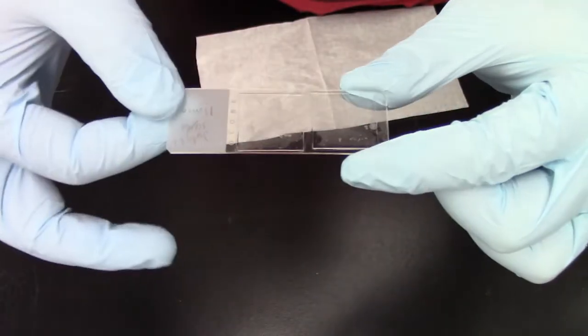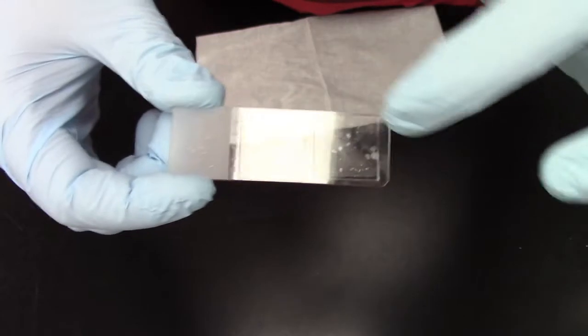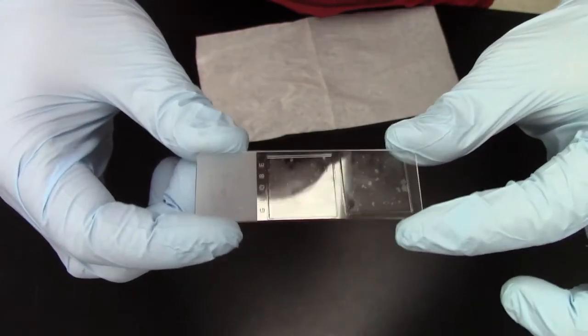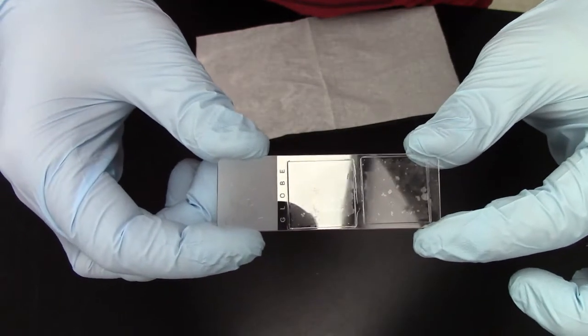And this slide has two sides, the flat side that has no coverslips and the side with two coverslips. Now when we mounted the coverslips we used a mounting solution. This mounting solution that we used is water based.